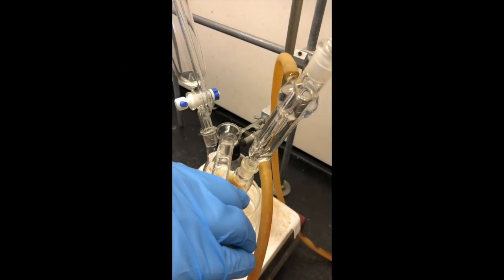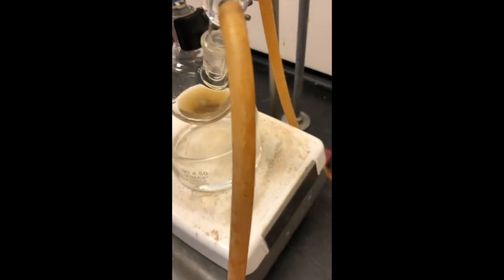We're adding another portion of ether. We could add through the condenser or through the top if you're very fast.